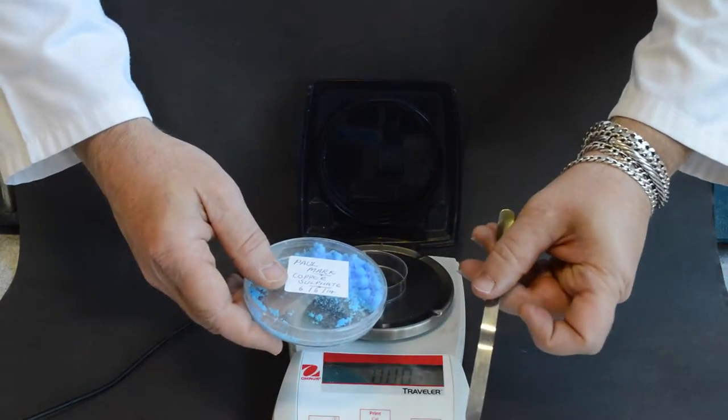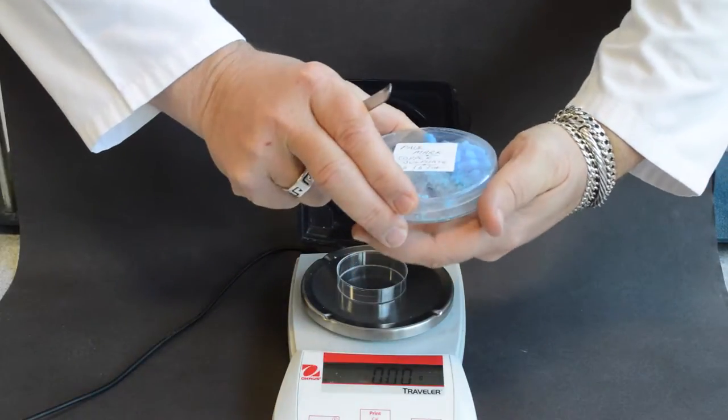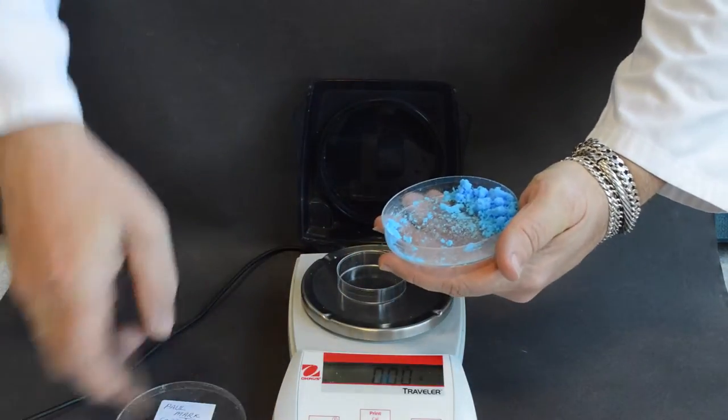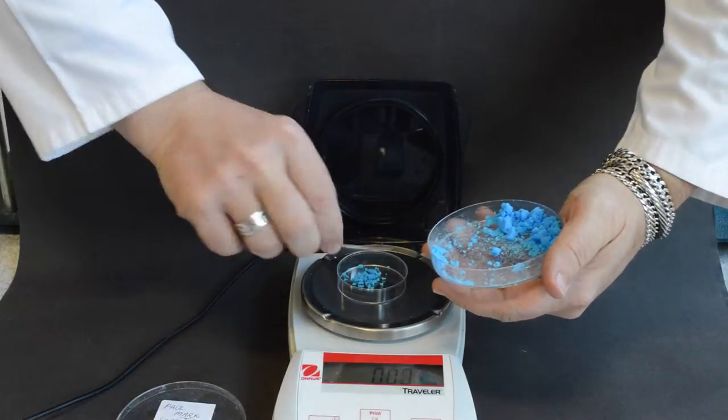Then using the spatula, weigh out precisely two grams of your sample into the weighing vessel.